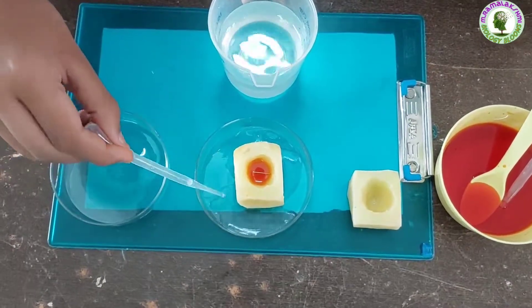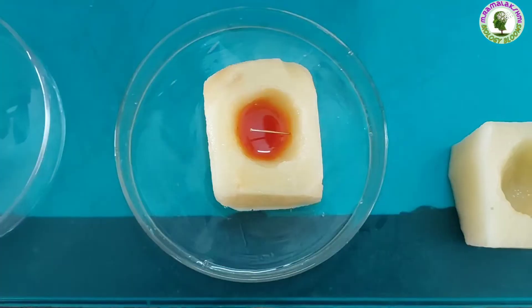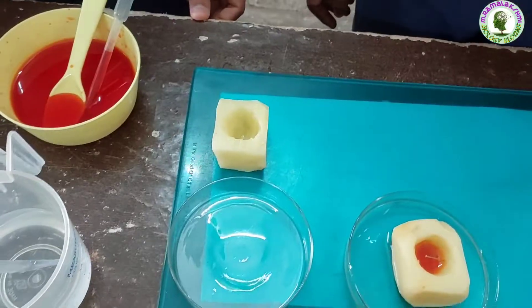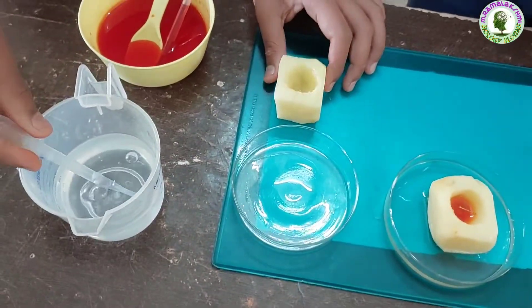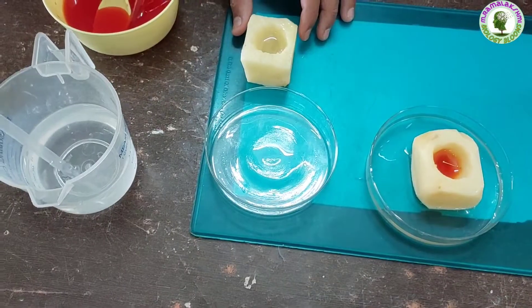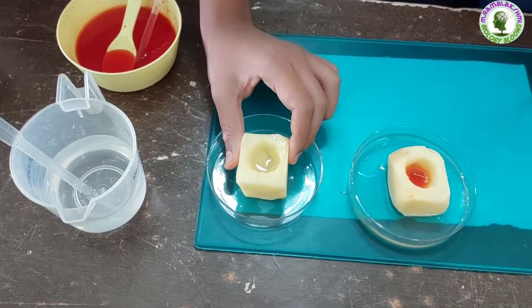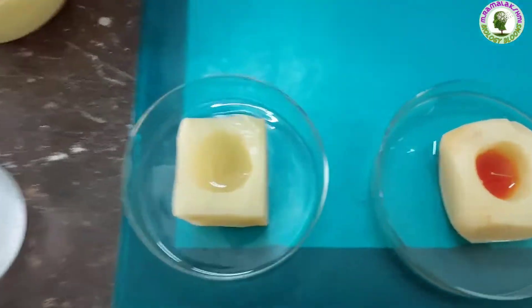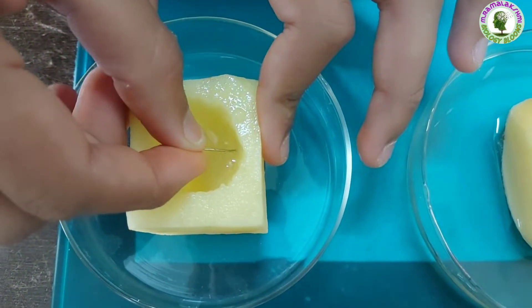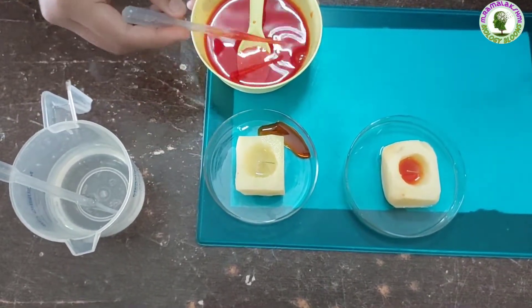Now pour some water into the petri dish. Harish, you take some water in the second potato cup. Keep it in a petri dish and mark the water level with a needle in the potato cup. Now pour some sugar solution into the petri dish.